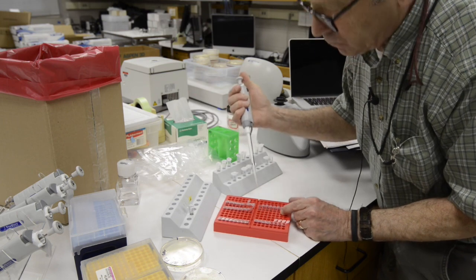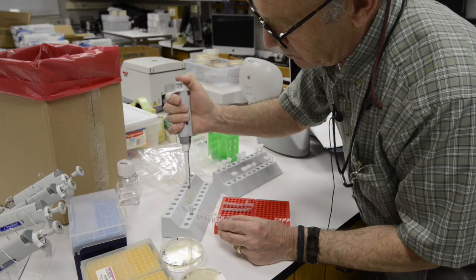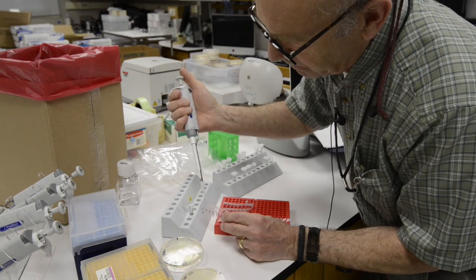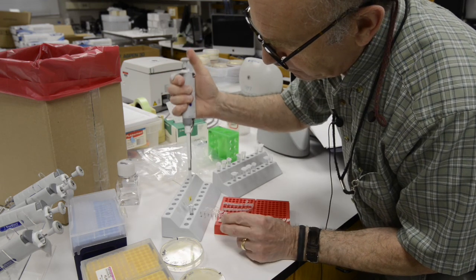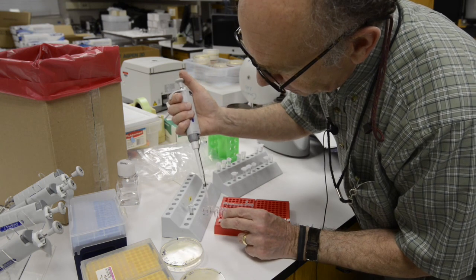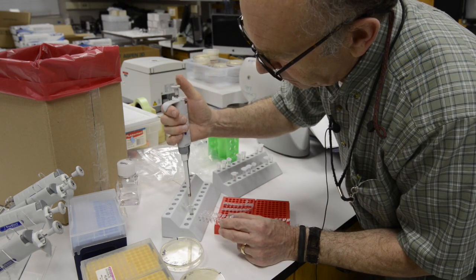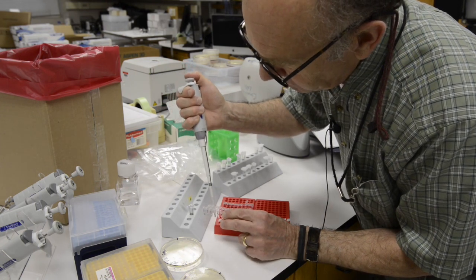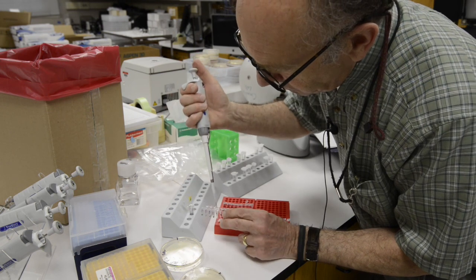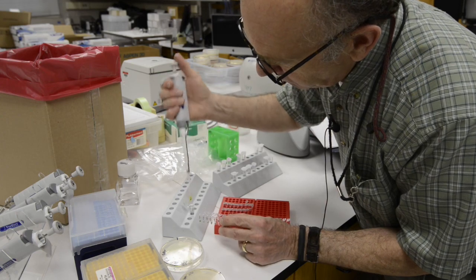Once you have that ready, then you're going to be ready to pull a sample by touching a bacterial colony from a plate and actually getting that material into your PCR tubes. When you're preparing those PCR tubes, make sure that you're preparing a tube not only for each sample but also for a negative control, and if your instructor indicates that they want you to do this, a positive control as well.